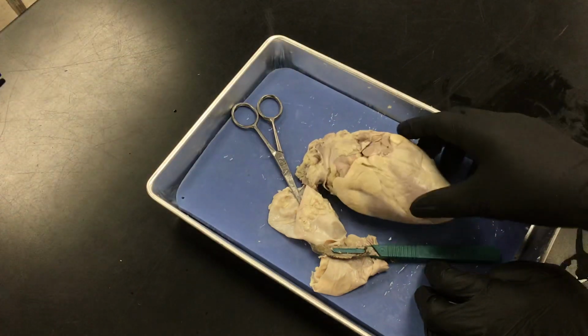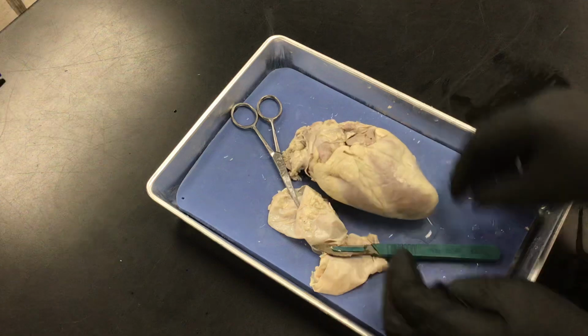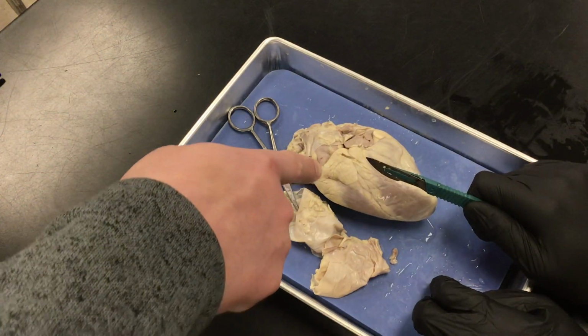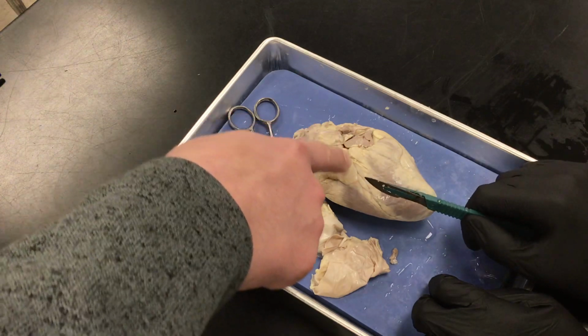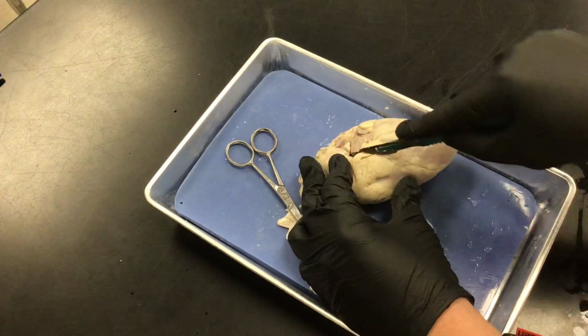Is that artery open at all, or is it not deep enough for that? What do we do after we cut this? Okay, let's cut. You didn't go that deep, so it's fine. Let's cut along this artery. Okay, you see that artery? Okay, here. And cut kind of deep along it.